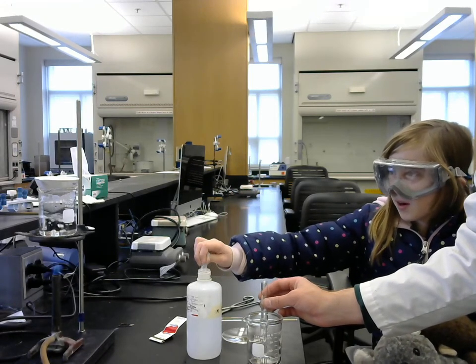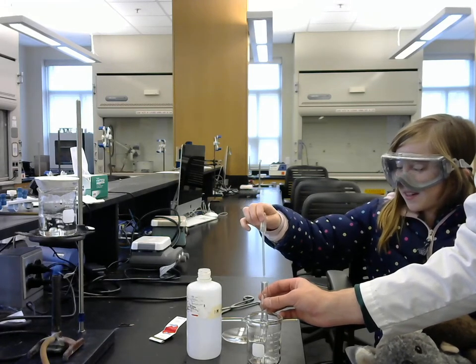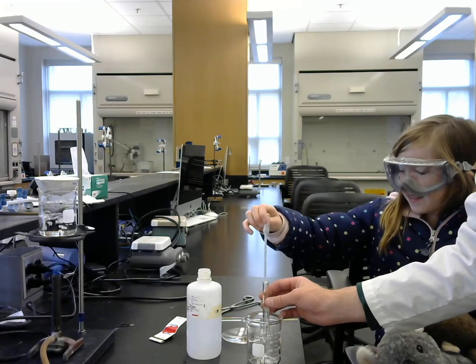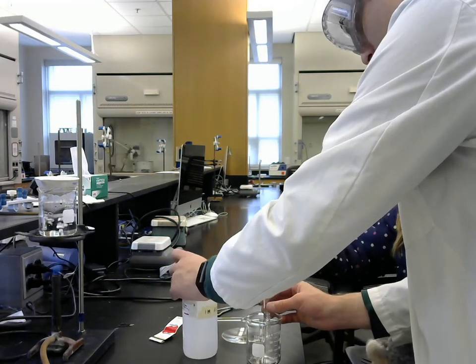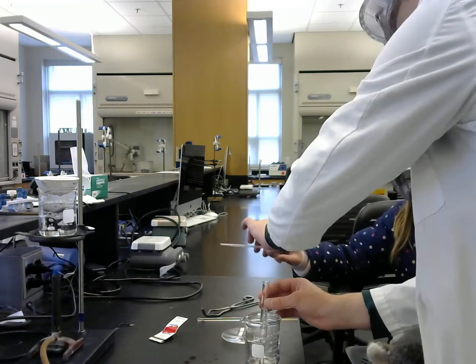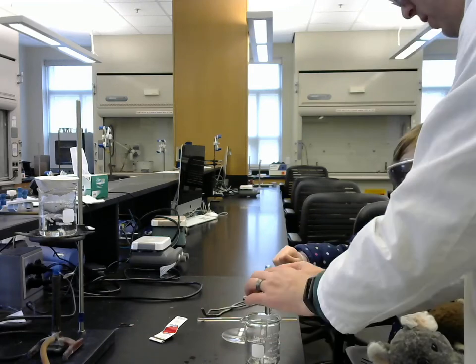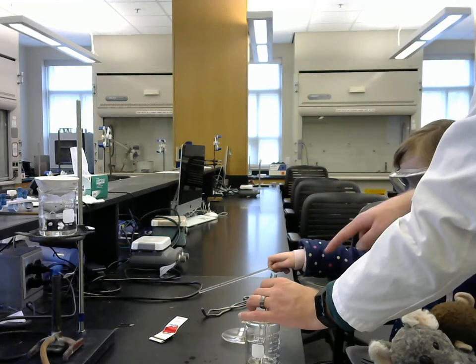I think I might have just almost acided my dad. If you do that, then I'll just wash my hand. That's right. Do you get an itchy rash if you don't wash it soon enough? With 1 molar hydrochloric, you probably would. Okay, could you use the stir rod? Dip it in here again.